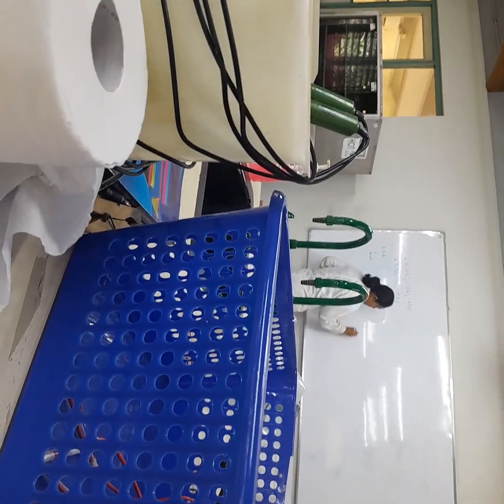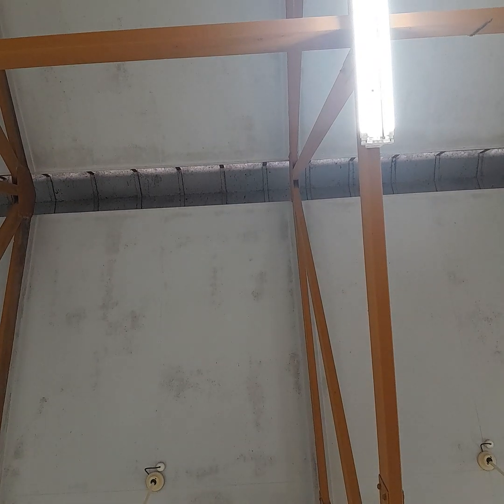Now this is going to be your potentiometric titration and your redox potential. So this is how your setup is going to look. You'll have your magnetic stirrer here. Remember, it's a magnetic stirrer. No heating. So you have your beaker here, and you have your burette here, where your burette will be clamped. We'll have a stirrer here that will keep on stirring.